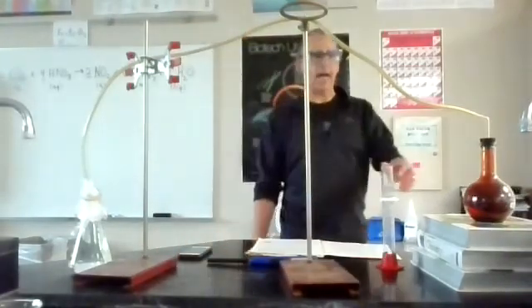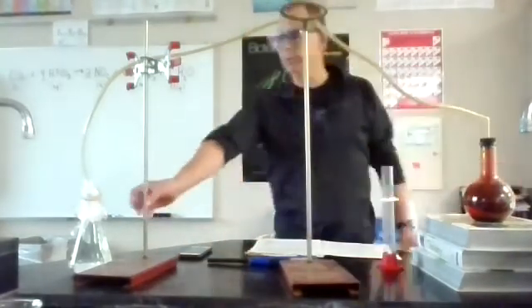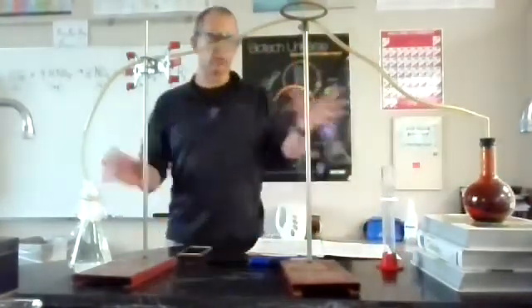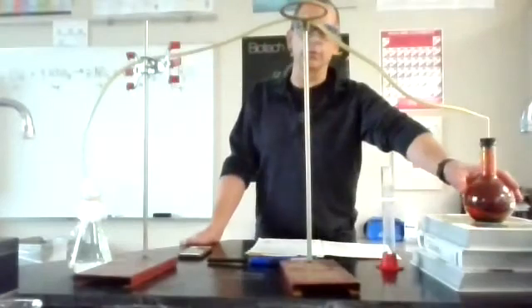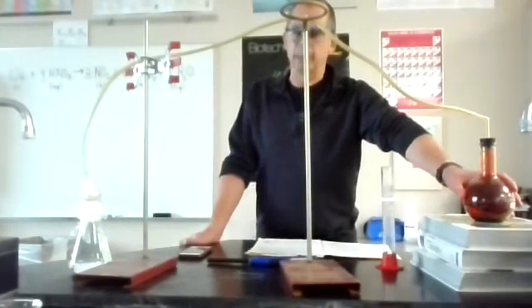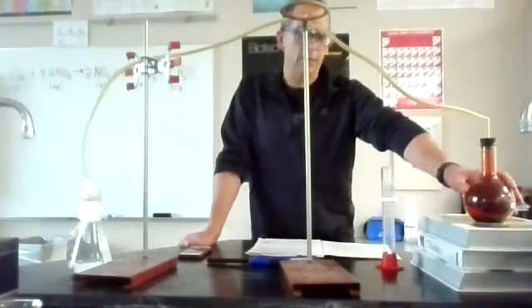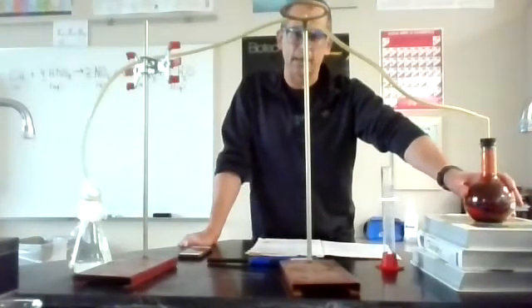So this was hot and it was still spewing out bubbles right there. But when it was done spewing out bubbles, it was real hot. The molecules are moving real fast. But then it got sealed off because bubbles weren't coming out anymore. And now the temperature is dropping back down because the reaction is done.